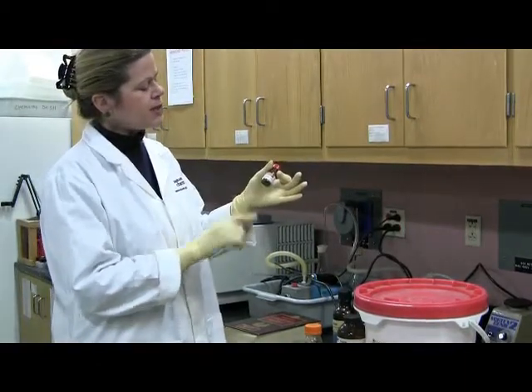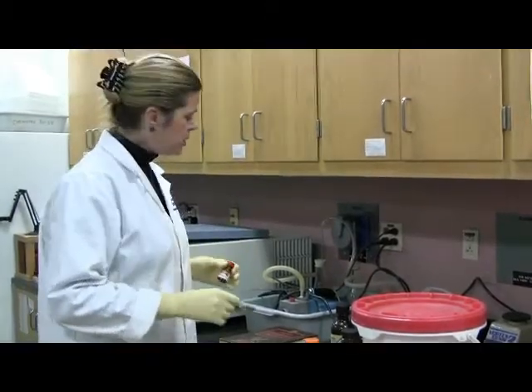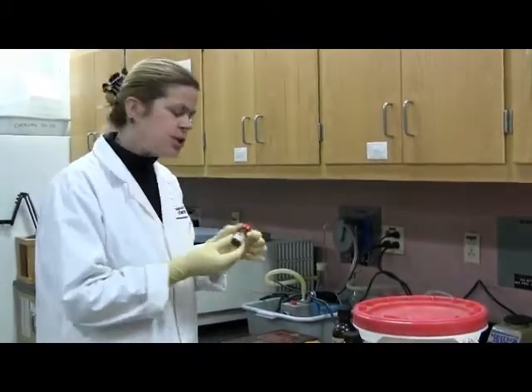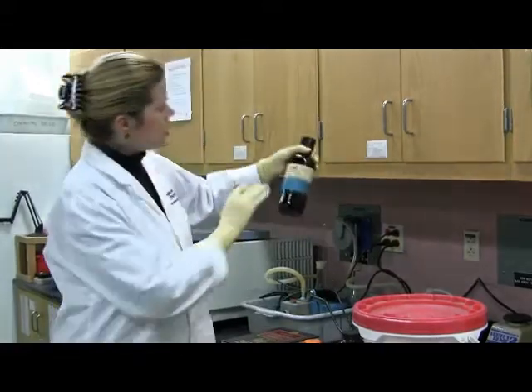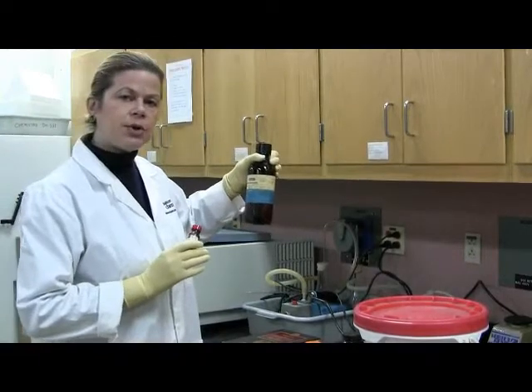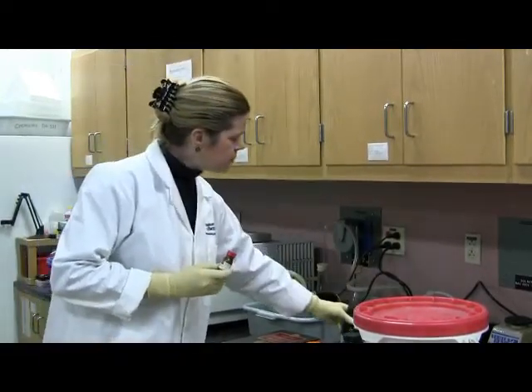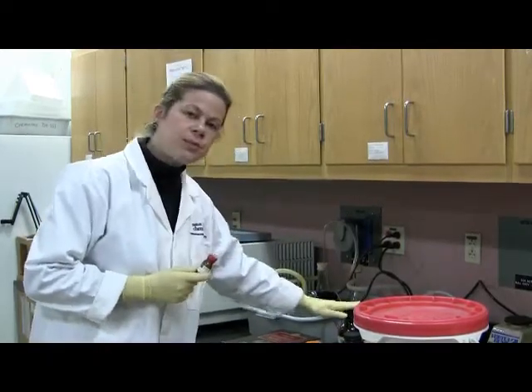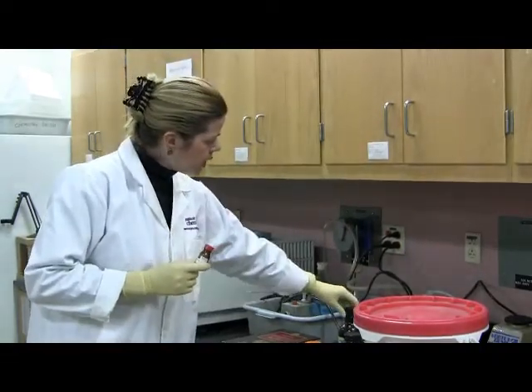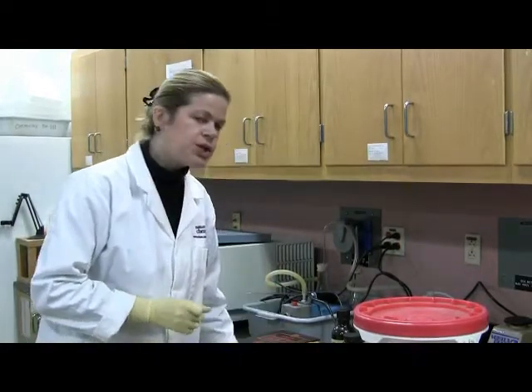Okay, but anyway, so the point is, this substrate has a very low solubility in water. So how are we going to make our substrate solution? We are going to dissolve it in dimethyl sulfoxide. Dimethyl sulfoxide is an organic chemical. We store it in the flammable storage cabinet. So you're going to get that. And DMSO is very hazardous. No, I am wearing gloves, and you need to do the same thing. Okay, so you're going to dissolve your substrate in dimethyl sulfoxide according to the instructions on the procedure.